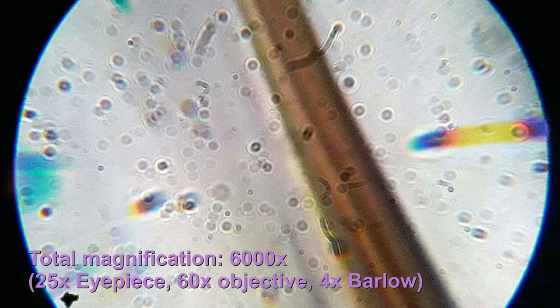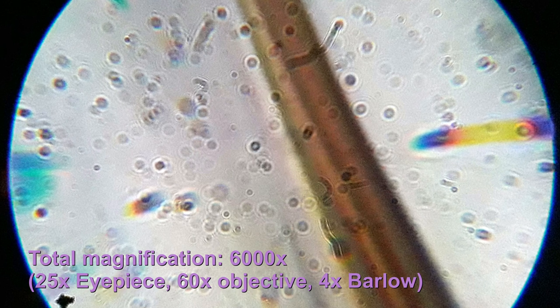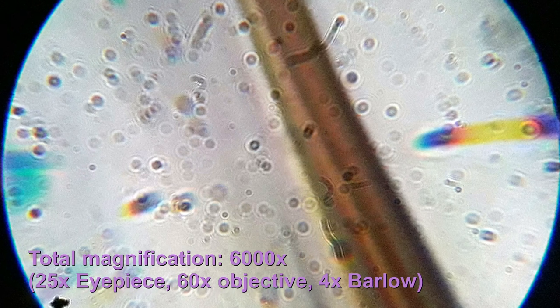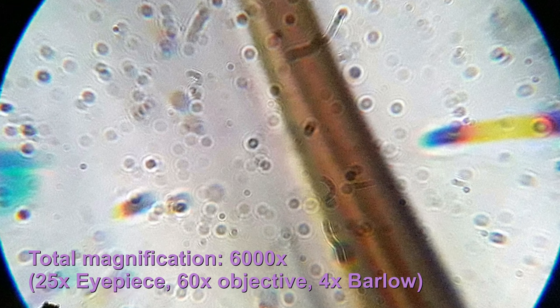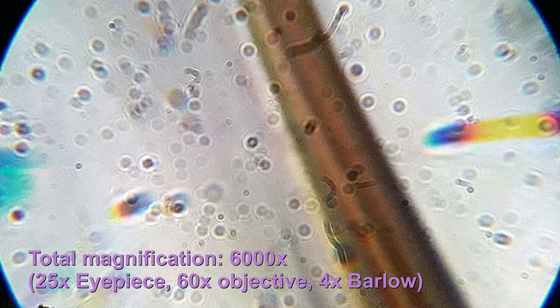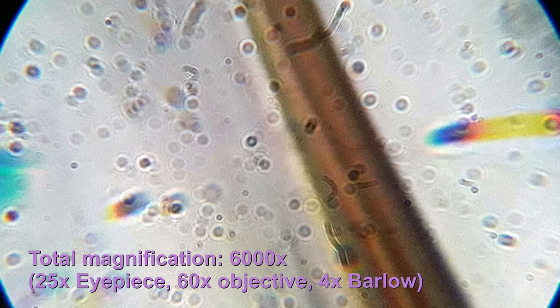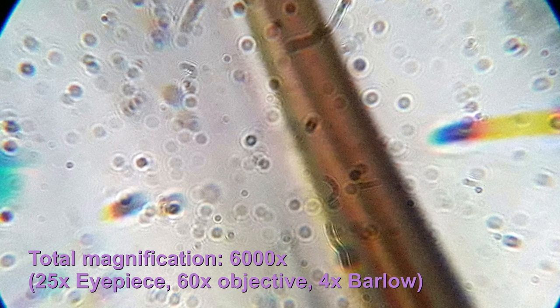Now 6,000 times and I was wondering what are all of those dots I see here? Well these are all dust on the eyepiece. It becomes that visible at this magnification, kind of disturbing. You also see some rainbow colors on the right side.